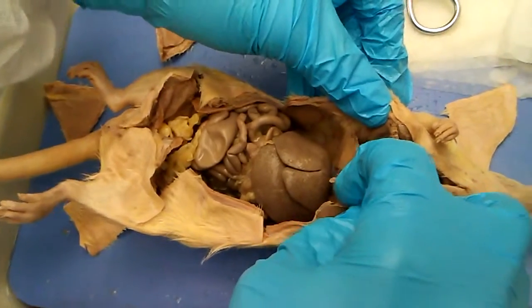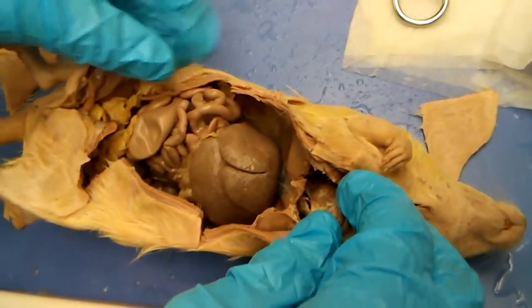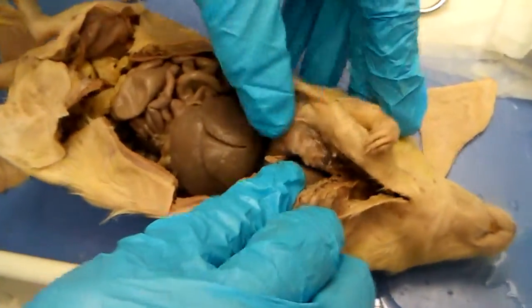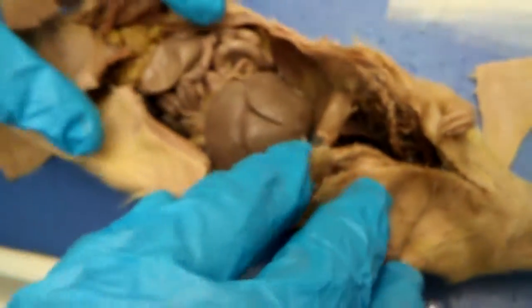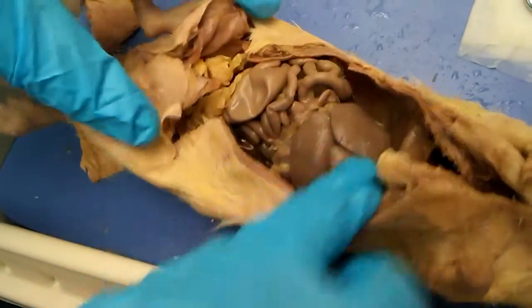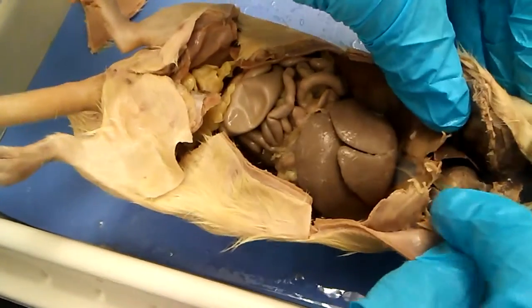Here you have the diaphragm that separates these organs from the thoracic organs. Then you have the thoracic area which contains the heart and the lungs on both sides. And then you have the abdominal cavity, which contains the digestive, excretory, and reproductive organs. To summarize: lungs right here, and the heart here as well.